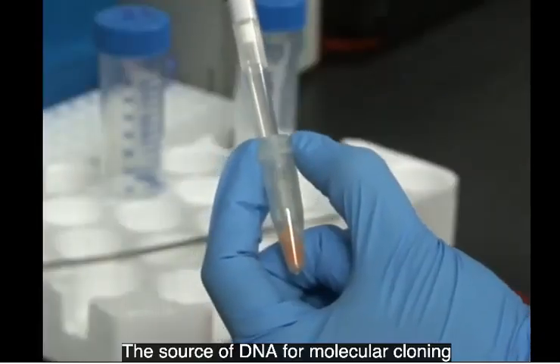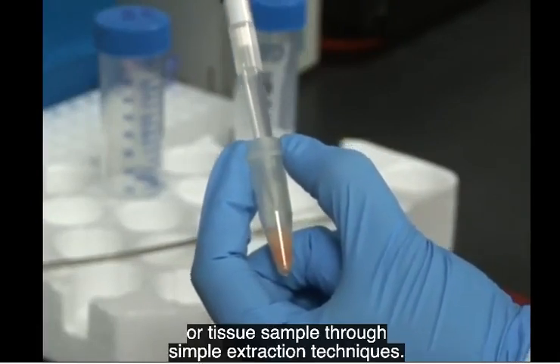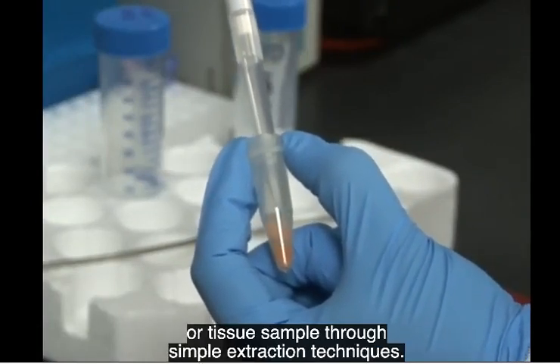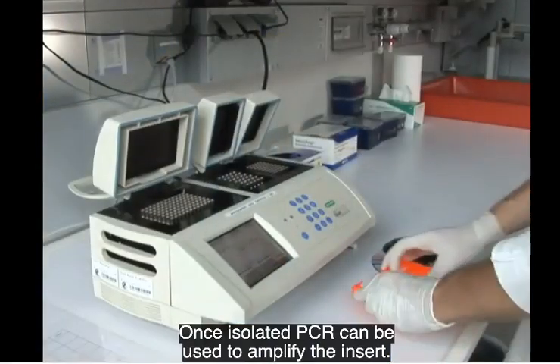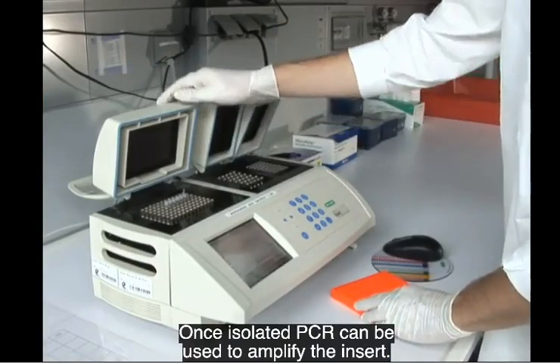The source of DNA for molecular cloning can be isolated from almost any type of cell or tissue sample through simple extraction techniques. Once isolated, PCR can be used to amplify the insert.